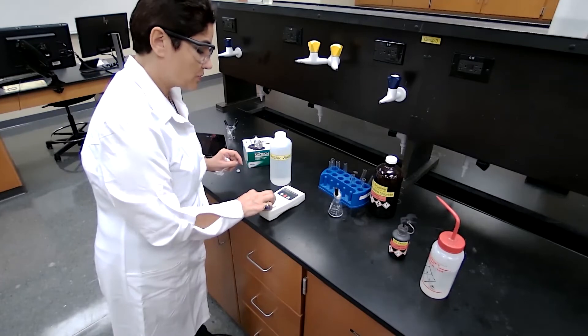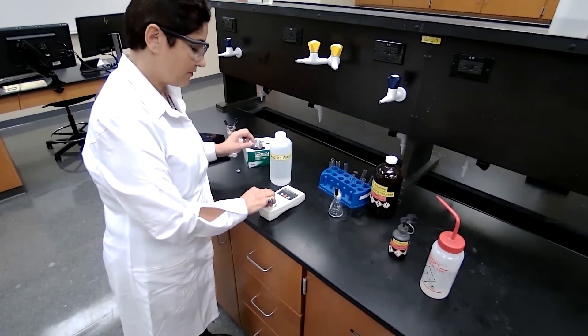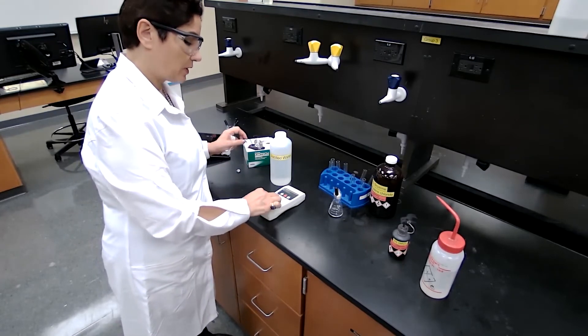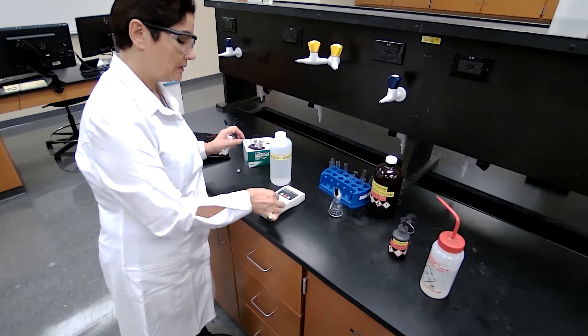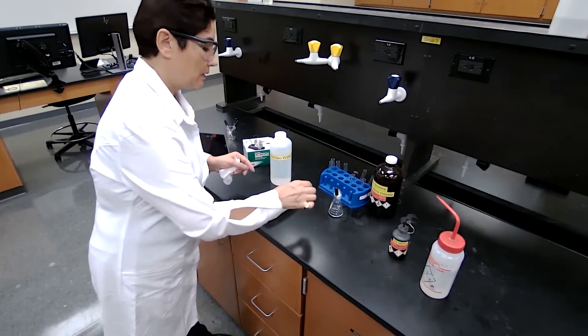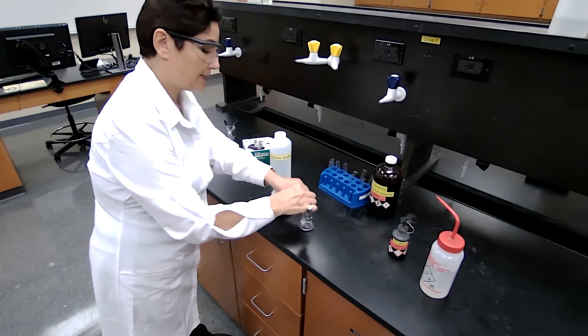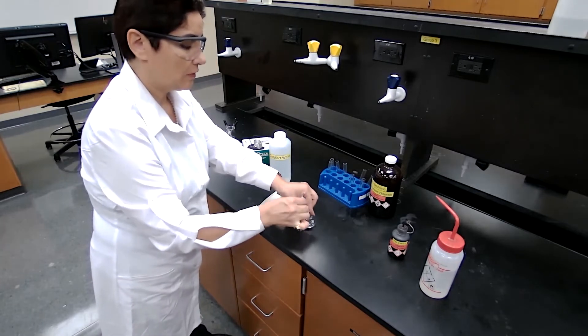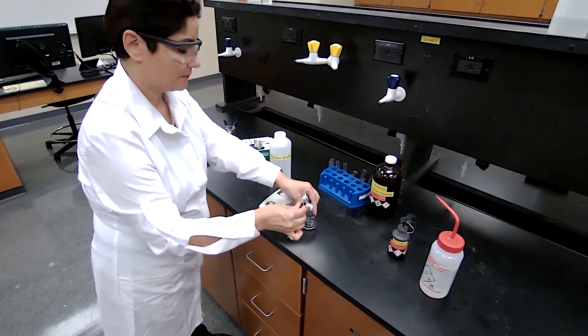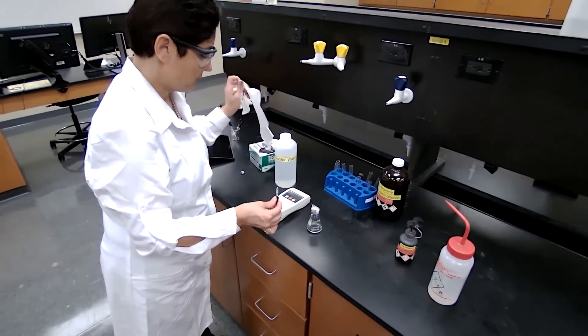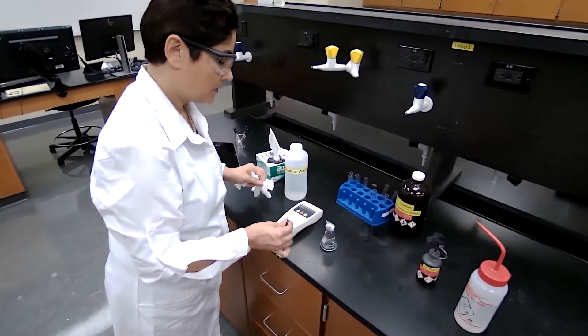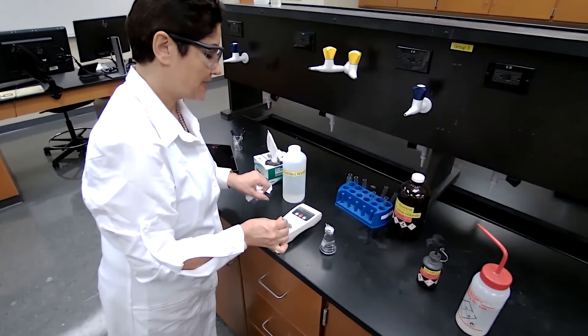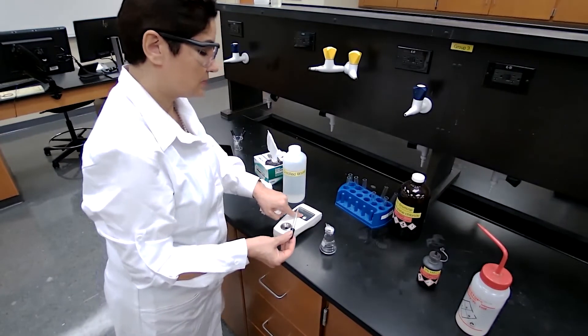We can clean up using a Kimwipe, the distilled water, and apply the sample, a few drops of the sample. This is after calibration. A few drops of sample and press read.